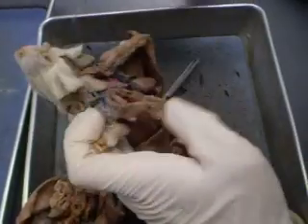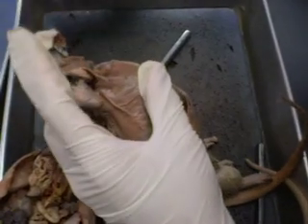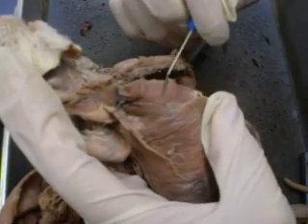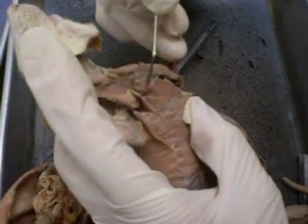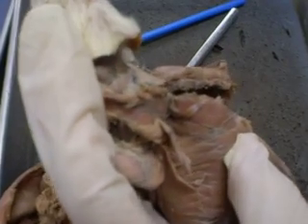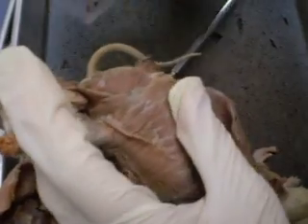Some of the deeper muscles include rectus thoracis, which is a strip of muscle that overlays the rectus abdominis. The rectus abdominis runs down all the way to become your abs. This is your rectus thoracis. It's a strip which is usually across the rectus abdominis. Think of it as kind of like a seat belt.